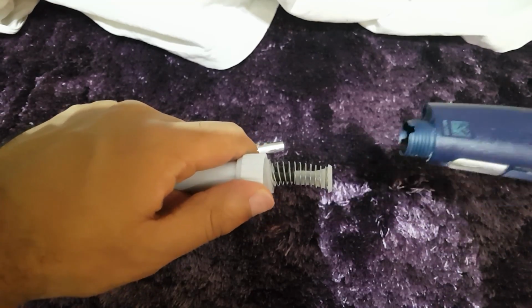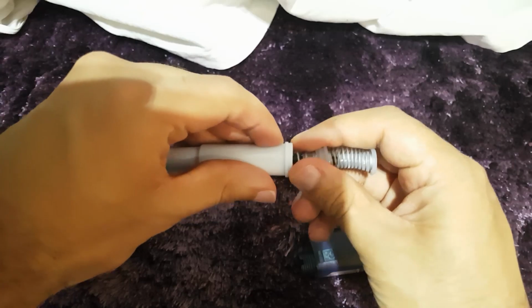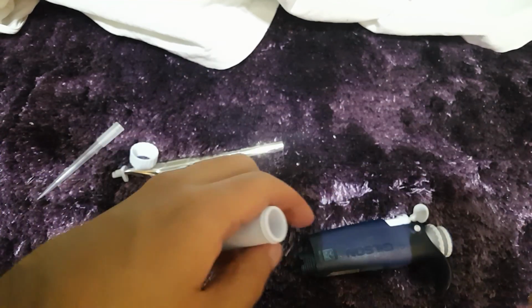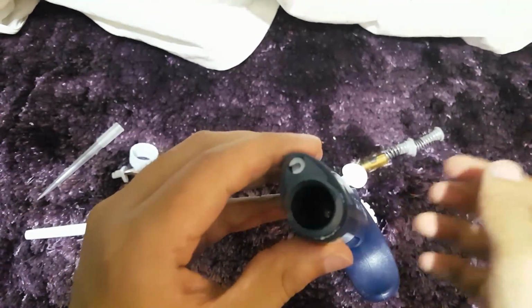Okay, now, as you can see, we come to the main part of the pipette in here. So, it simply just pops out, and this is the air chamber inside in there. So, let's try and have a look at what's wrong. And since we're here, do we have a look in here?